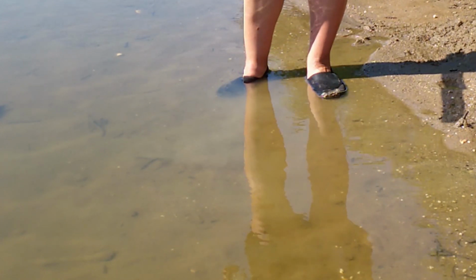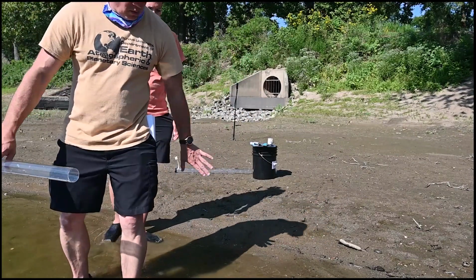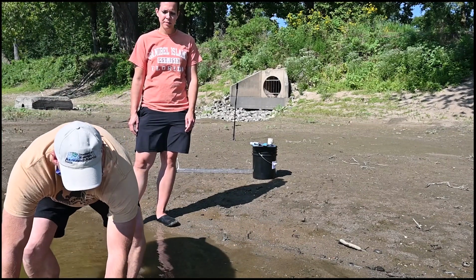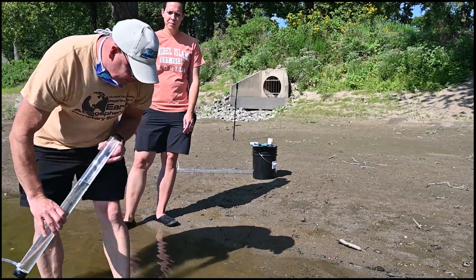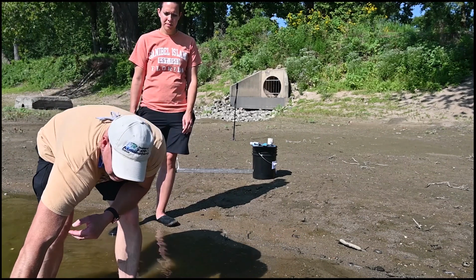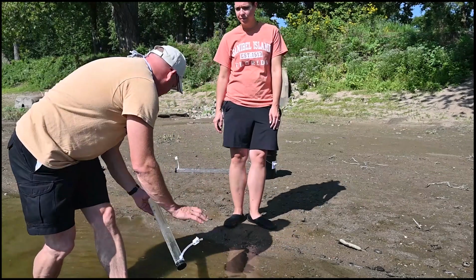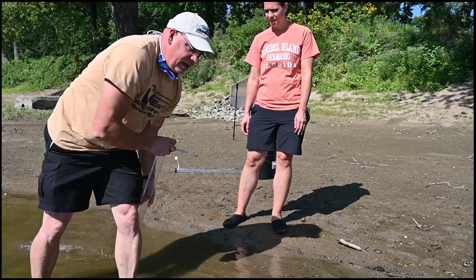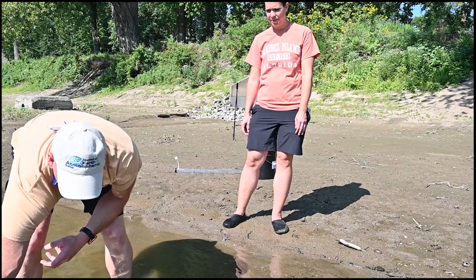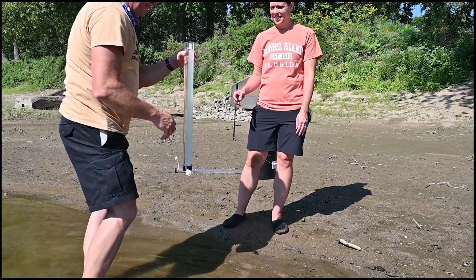Right. And so what we would have to do is I'll step out further from where we were, since that's all washed over there. And what I'm going to do is just gently fill this up. Now I have to reach pretty far to fill this up. I'm going to rinse it and dump it downstream because the water's going this way. And so I want to do that a couple of times. Now the water's moving slowly enough. We'll get that out of the way. And I'm going to reach out just a little bit further. And I filled it up. Whoops, almost all the way. Got excited. All right, so I've filled this up.